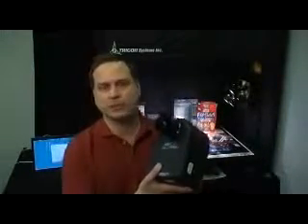Here at TRICOR we are excited about a brand new product called the Model 600 Imaging Spectrophotometer. This single device is capable of measuring reflective color, transmissive color, as well as radiated color.